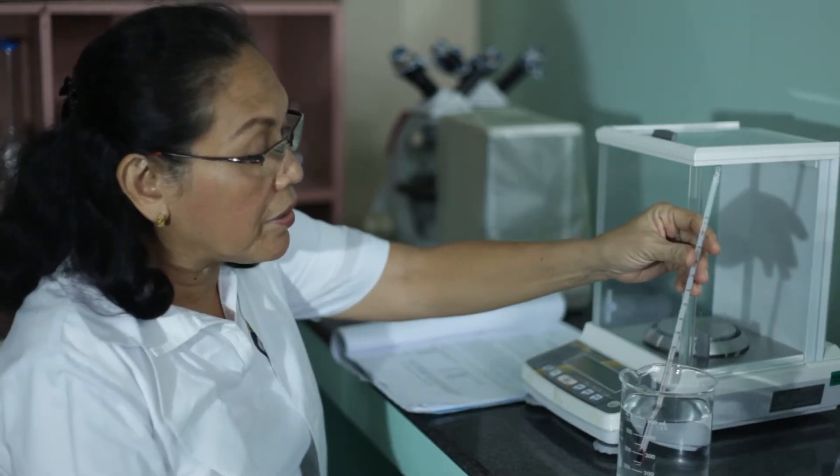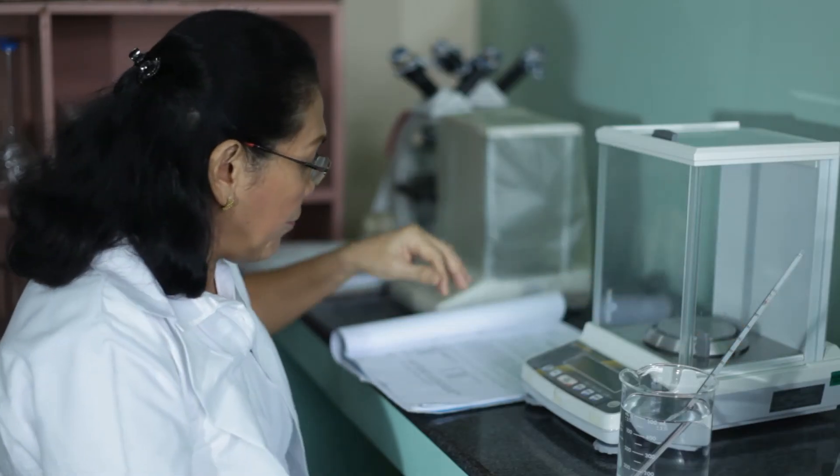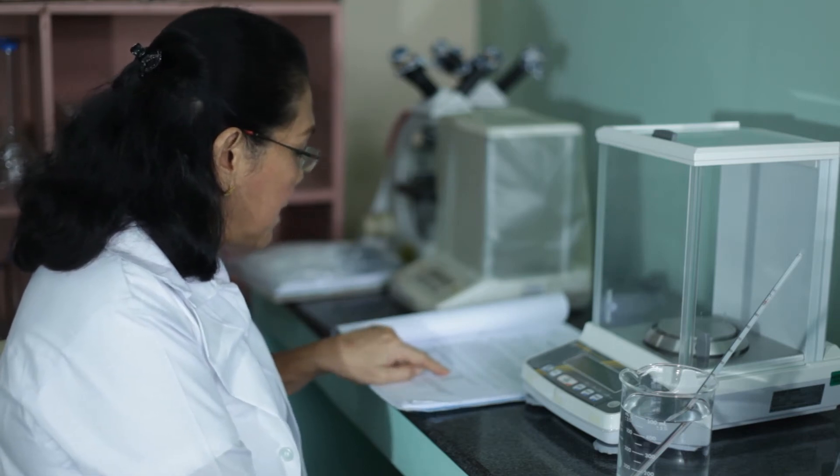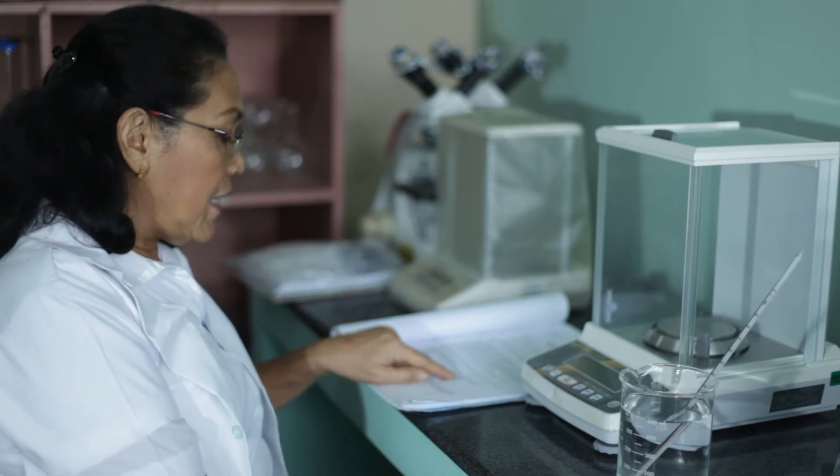The temperature of the water at this very moment is 21 degrees centigrade. If you look at your table, the density corresponding to 21 degrees centigrade is 0.99802 grams per ml.